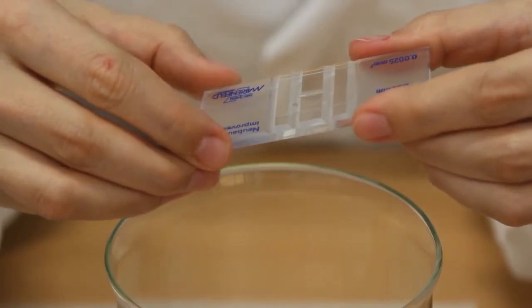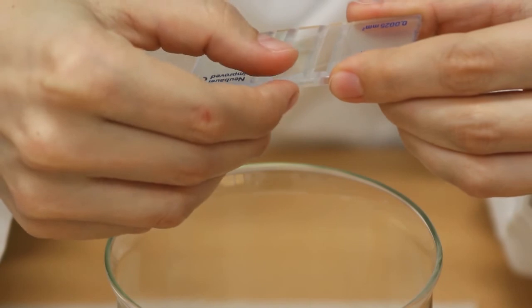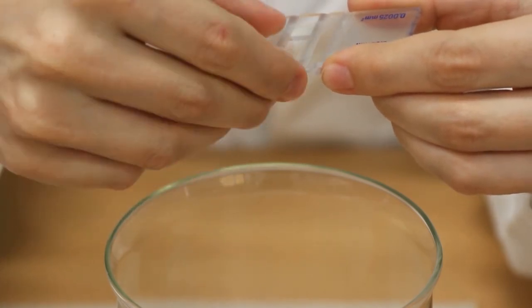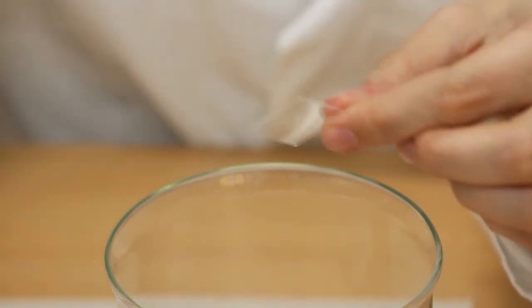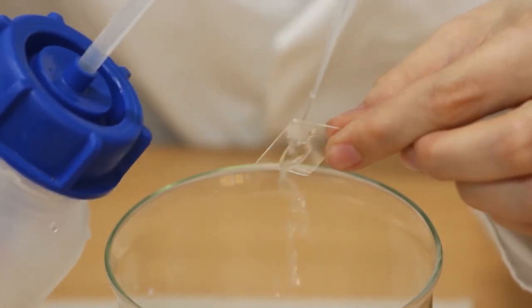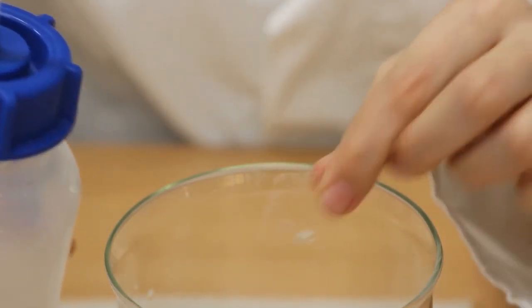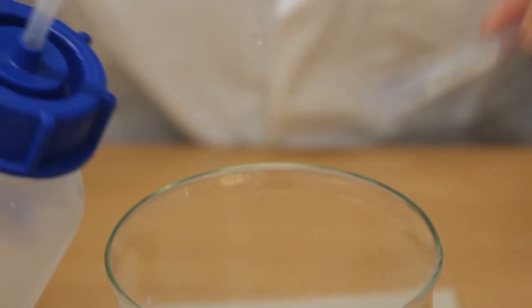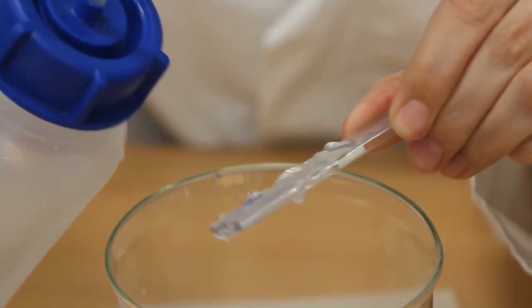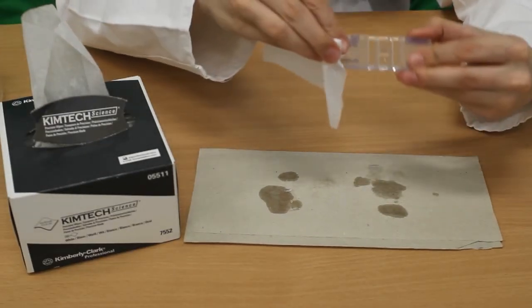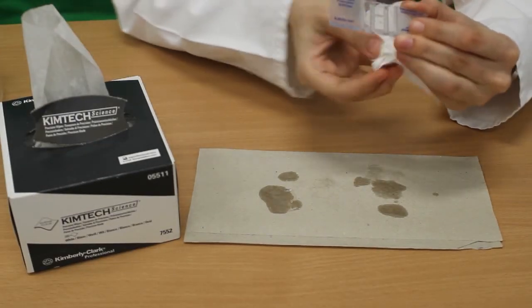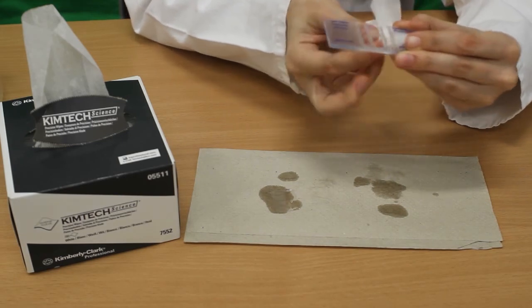When you're done with counting, remove the cover slip carefully from the side. Rinse the cover slip with water and the slide. Dry both with a piece of paper. Pay attention not to dry the middle structure since this can destroy the counting grid.